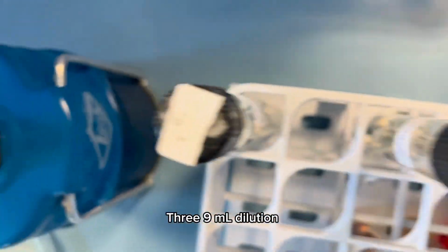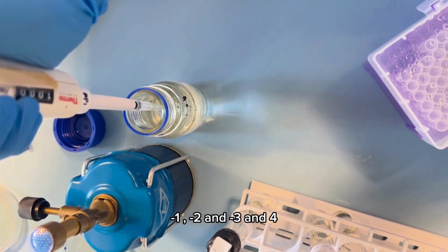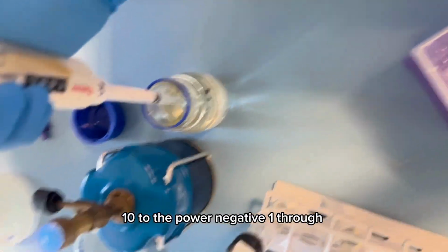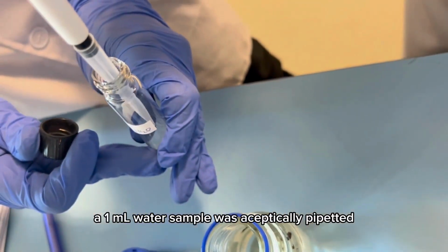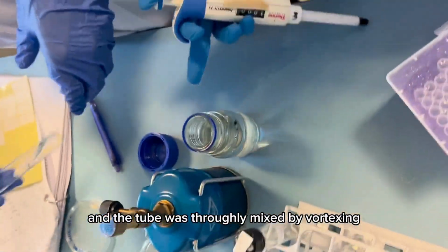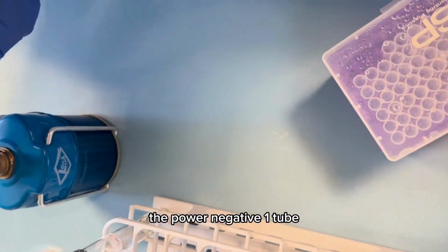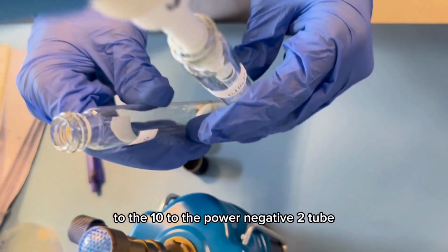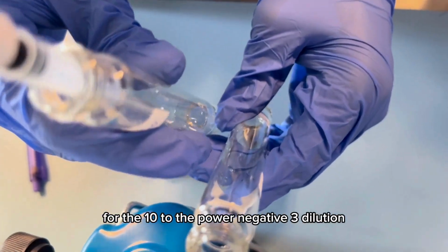3 9 ml dilution water blanks were labeled 10 to the power -1, -2, and -3, and 4 nutrient agar plates were also labeled 10 to the power -1 through 10 to the power -4. A 1 ml water sample was aseptically pipetted into the 10 to the power -1 dilution tube, and the tube was thoroughly mixed by vortexing. Using a new pipette, 1 ml was transferred from the 10 to the power -1 tube to the 10 to the power -2 tube, and the process was repeated for the 10 to the power -3 dilution.